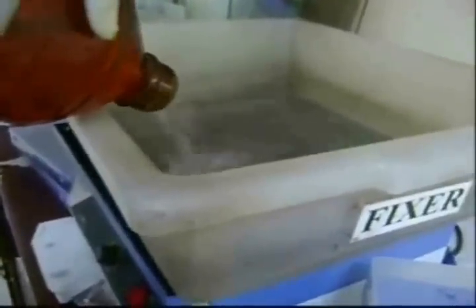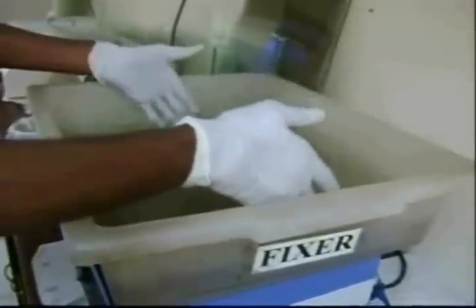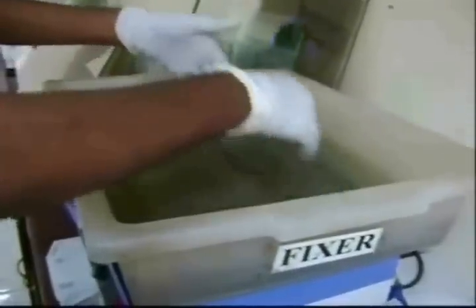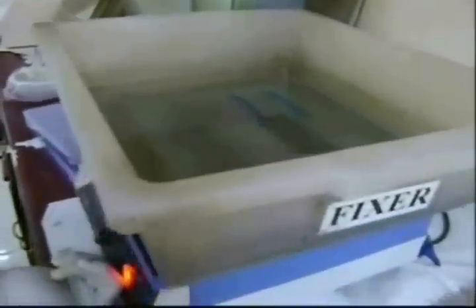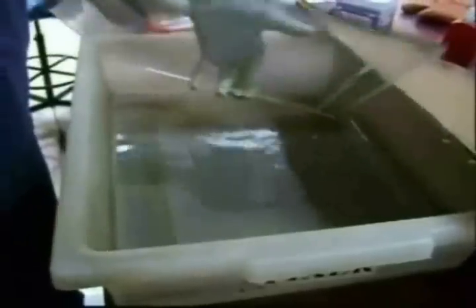For the silver staining procedure, the fixer solution is first poured into the tub. The fixer solution contains acetic acid and water. The glass plate is immersed into the fixer solution and allowed to shake on the shaker for about 15 minutes. The plate is then removed and given a distilled water wash. After the wash, the plate is subjected to staining solution for about 15 to 20 minutes. The staining solution contains silver nitrate and formaldehyde.